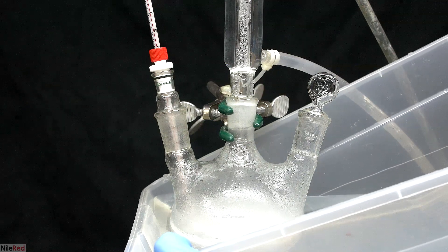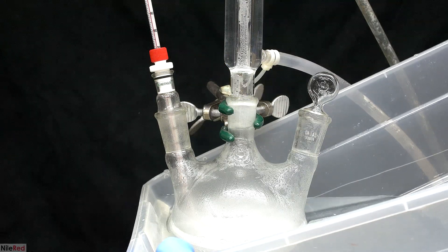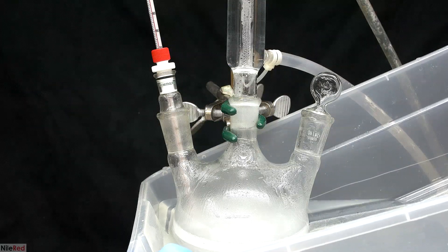This was really unexpected, because I was following a paper, and they never mentioned anything like this happening. Anyway, the cold water worked pretty well, and the reaction quickly slowed down.